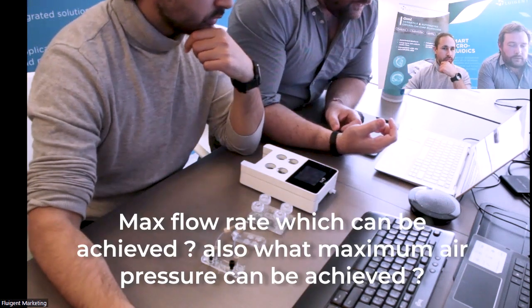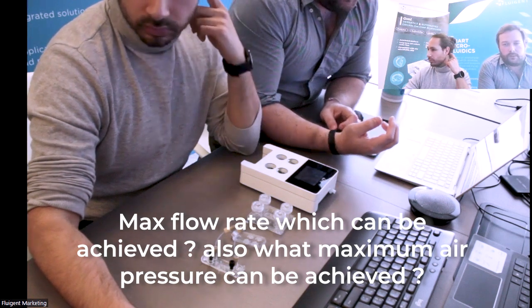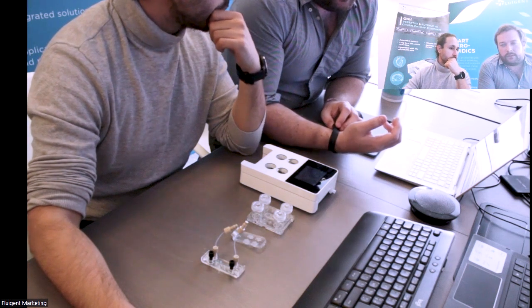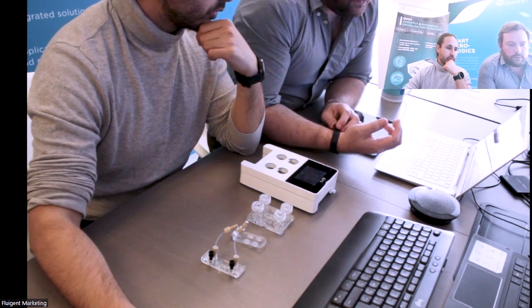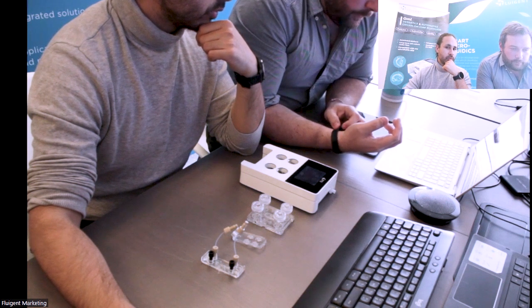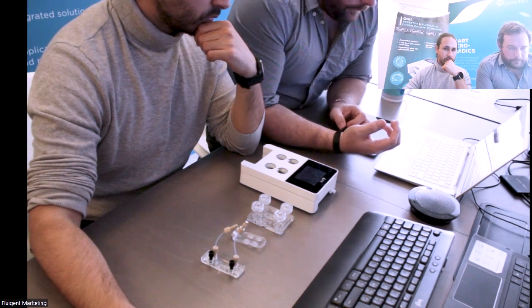The maximum flow it can reach is 1 milliliter per minute. It can actually go a bit higher, but we don't certify that it will be well controlled. So you can consider it can go up to 1 milliliter per minute. And the maximum pressure it can reach is 600 millibar maximum.